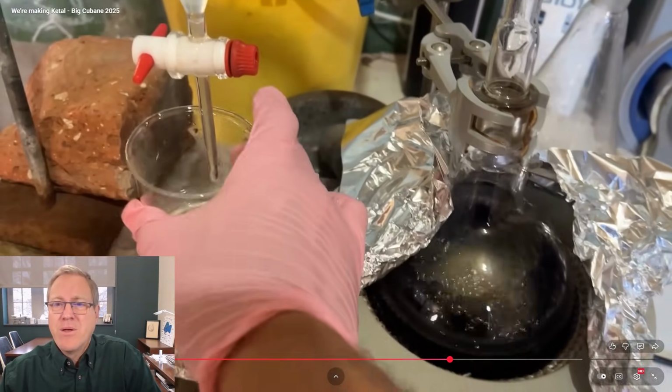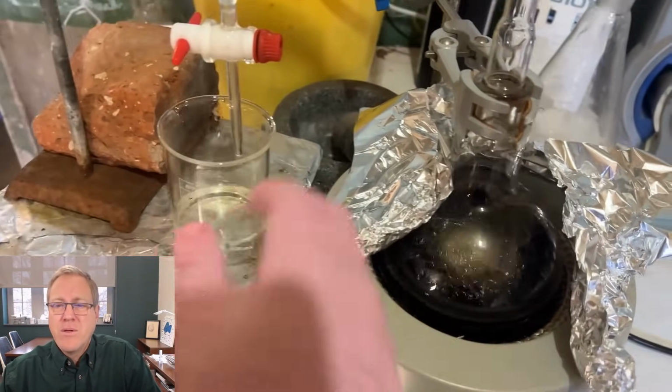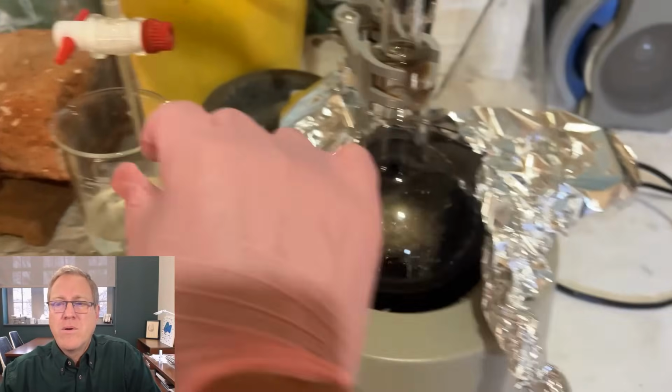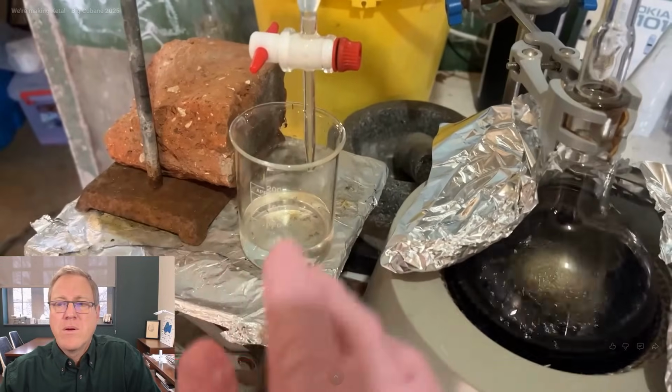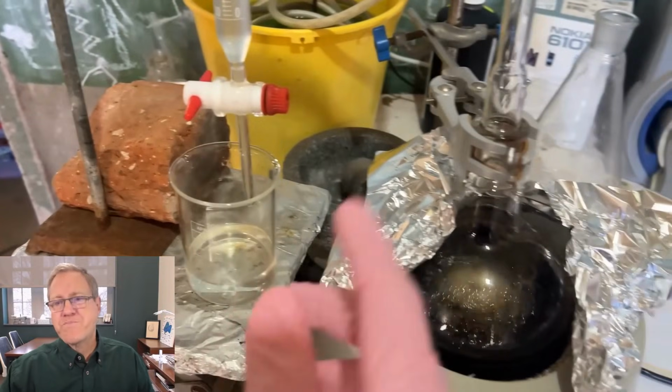We have here about 60 mils, actually I just measured it, 61 mils of water, which we've basically extracted from this reaction, and it tells us that our reaction is progressing. We expect about 80 mils. There was some extra water, but I was just chucking it away before. Okay, I want to pause here. He talks about the amount of water. How does he know how much water? Well, let's put this on the screen.